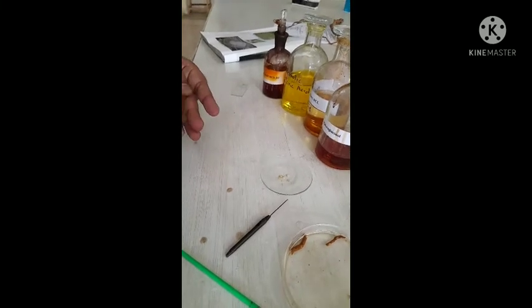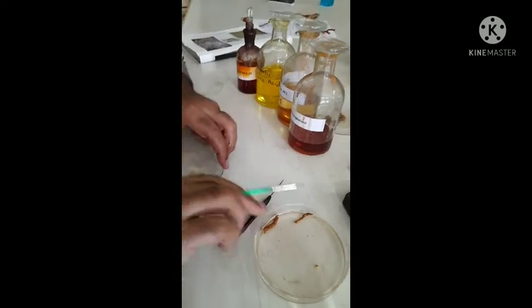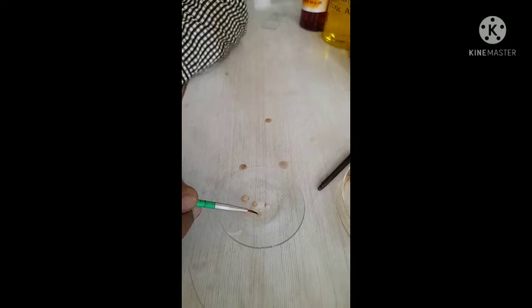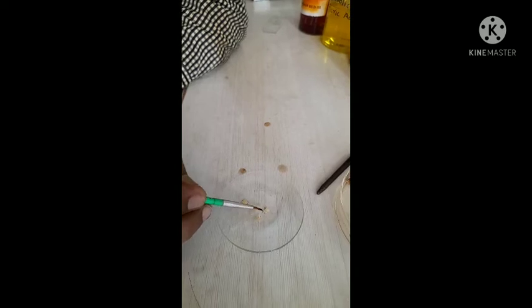Transfer it. Then clean the section in a watch glass to remove the debris which is present. Along with the section, remove the debris, fibers, and filaments from the section. Select a thin transparent clean section and keep it aside in the watch glass.